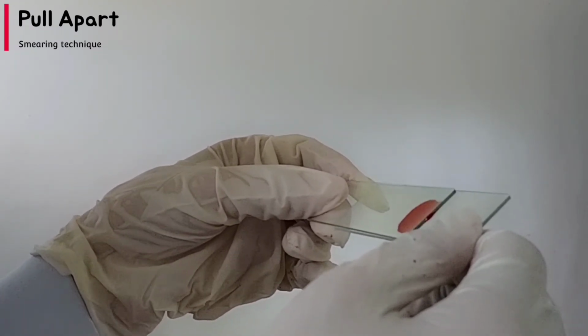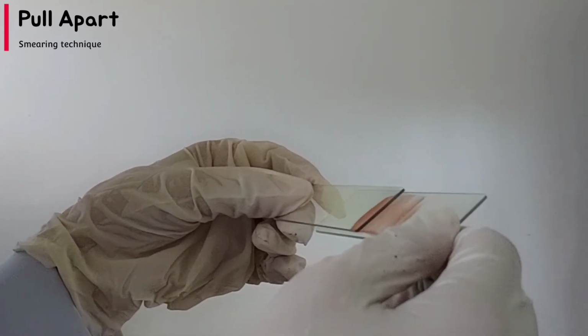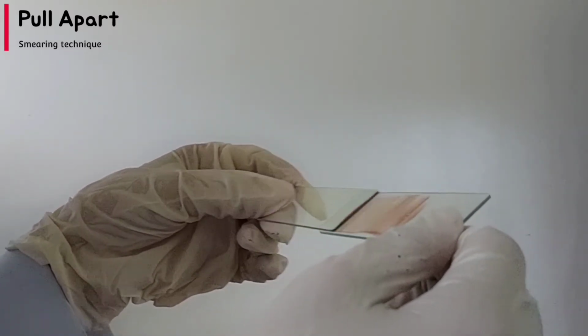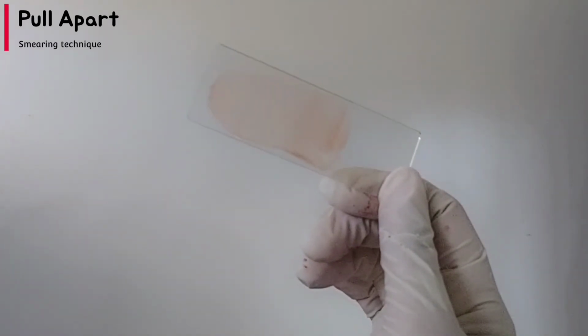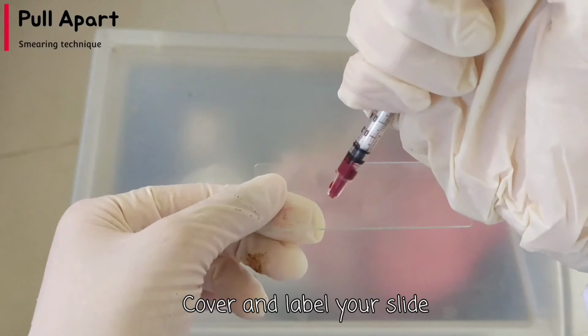Allow the sediments to be spread evenly between the attached surfaces of the 2 glass slides. With a single uninterrupted motion, pull the 2 slides apart in opposite directions, then cover the smear with a cover slip. Don't forget to label your slide.